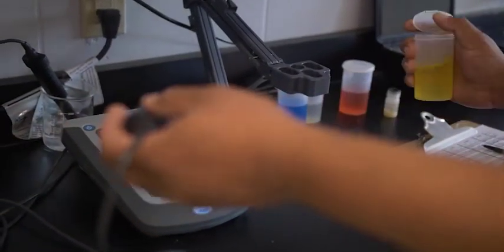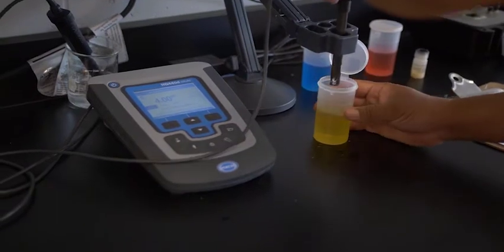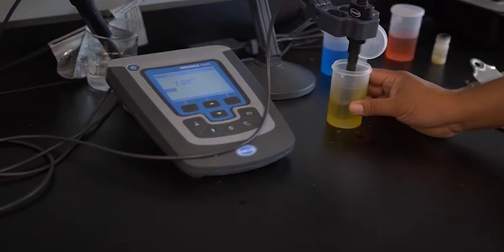We'll do it maybe once a week or twice a week just to ensure it's reading properly, but for the pH we like to calibrate daily.